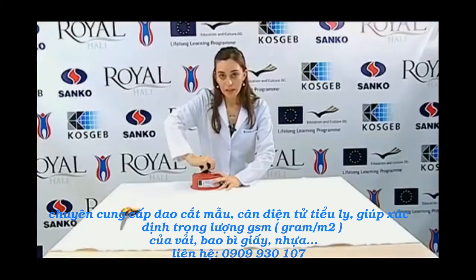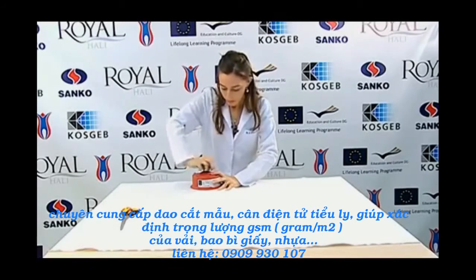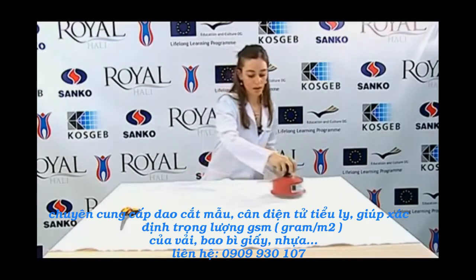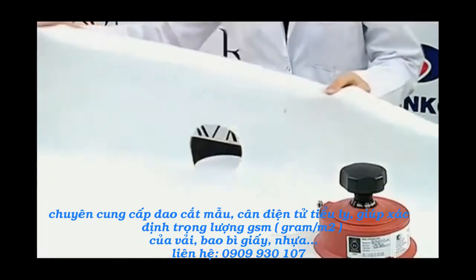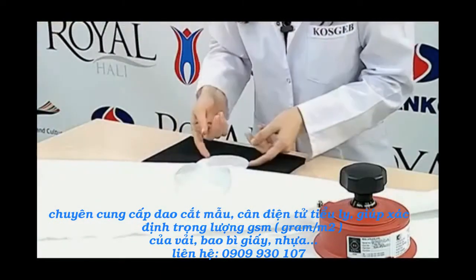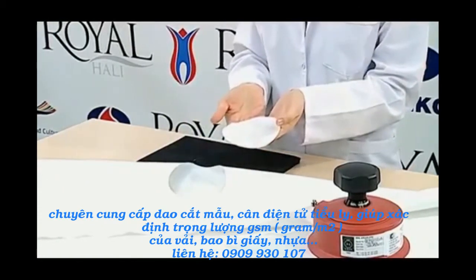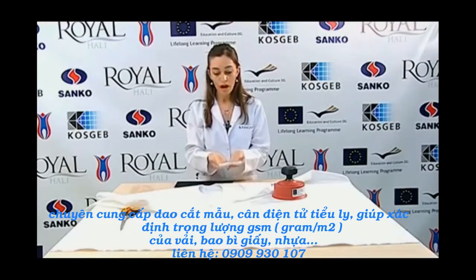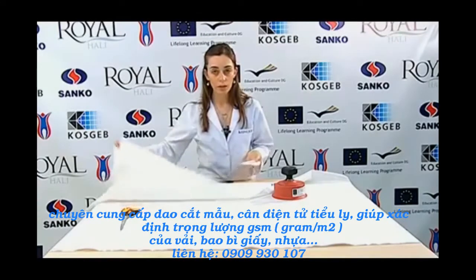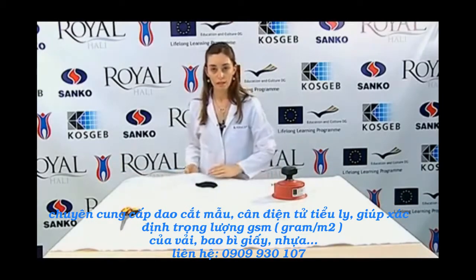With our arm, we turn it for 1 or 2 turns without pressing too much. We lift the sample holder. Then, I lift the sample without causing any yarn loss. This way, I complete the preparation of the sample of a 100 square centimeter circular area. I repeat the same task 4 more times to have a total of 5 samples.